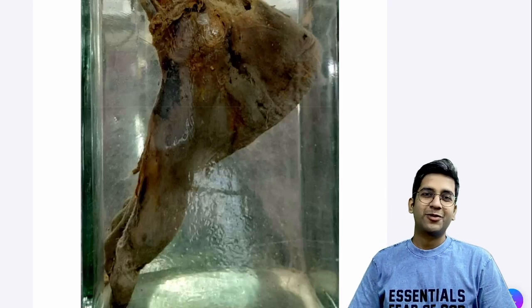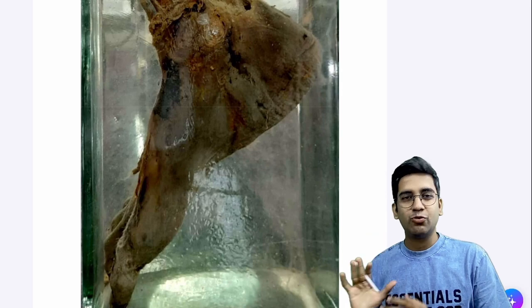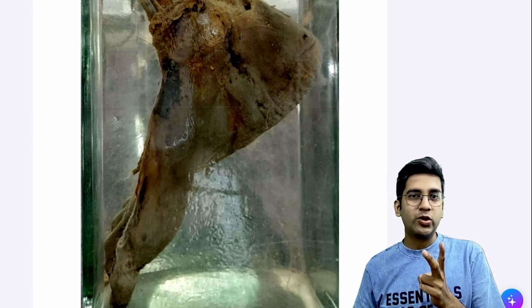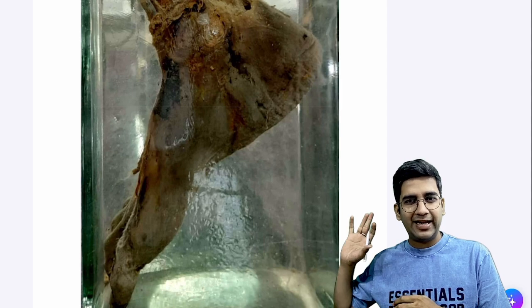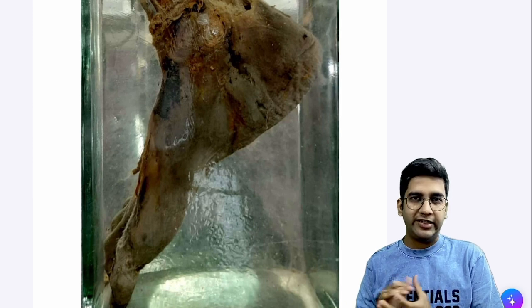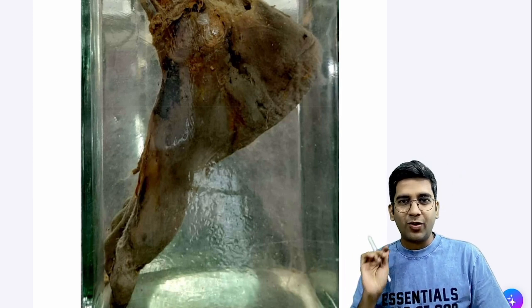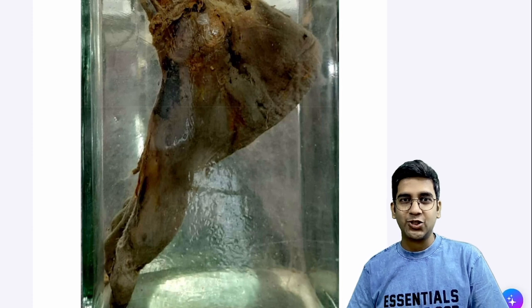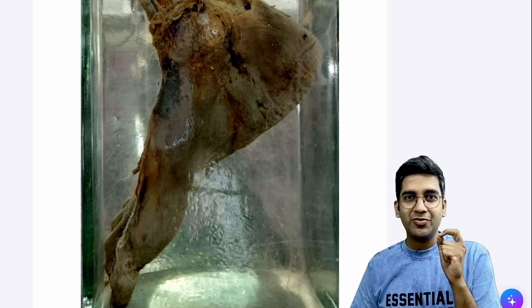Hello guys, welcome back to Ranjit Diyar Pathology. I'm Dr. Ranjit. We are going to discuss one more classical gross specimen which can come in your MBBS practicals. I'm going to show you two cases — both of them are classical cases of gangrene. You might have seen either a foot in the form of a jar specimen or a gangrene of intestine. We'll discuss quickly in about five minutes. Last time when I asked a query, you guys didn't answer — I want you to actively involve and comment so we can diagnose and learn together.